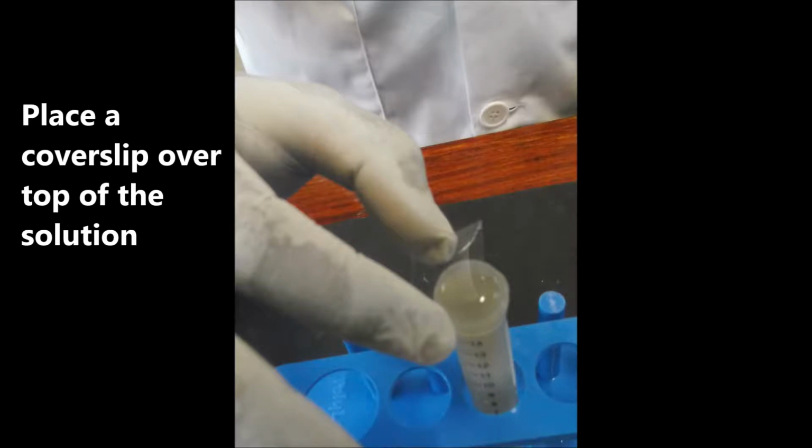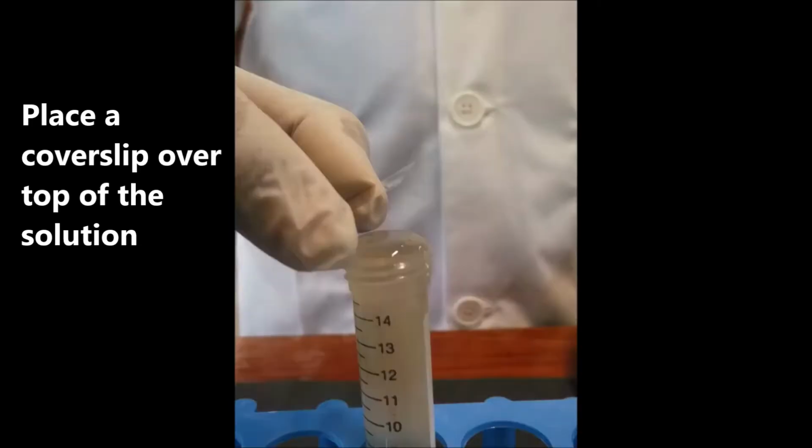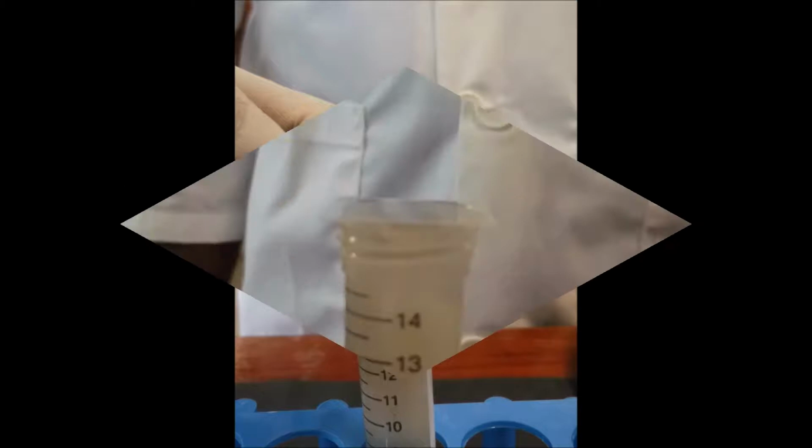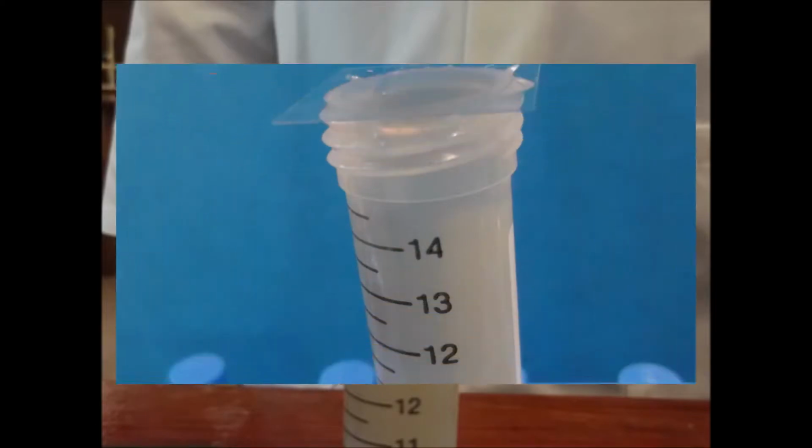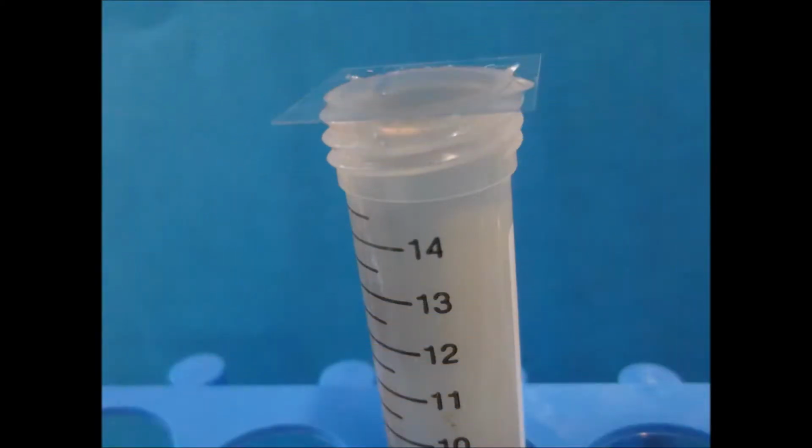Take a cover slip and carefully place it over the top of the solution. You must do this very carefully, making sure there are no air bubbles trapped under the cover slip.